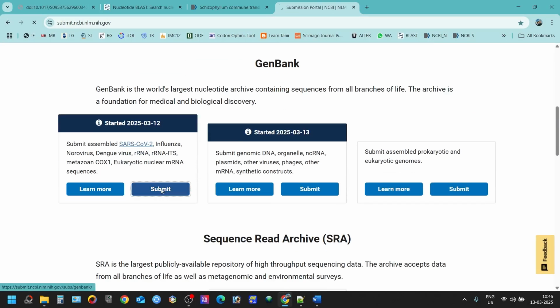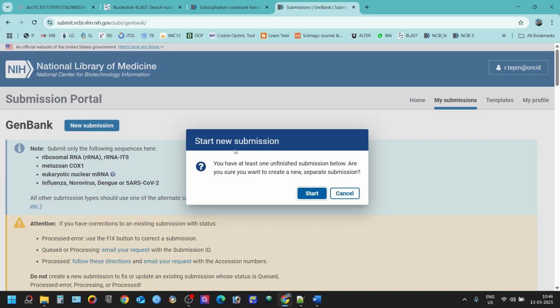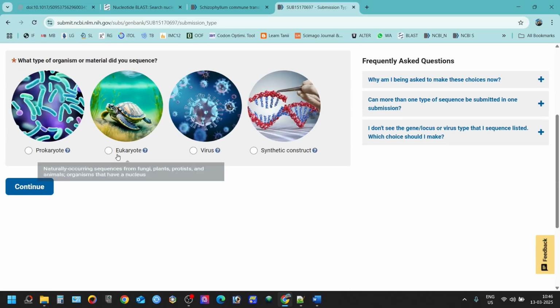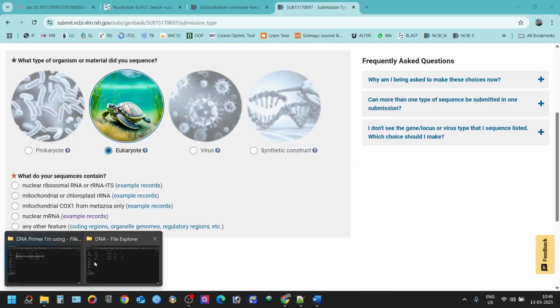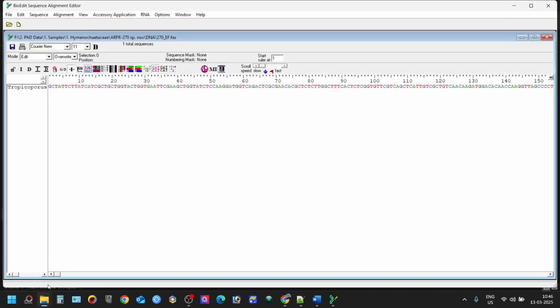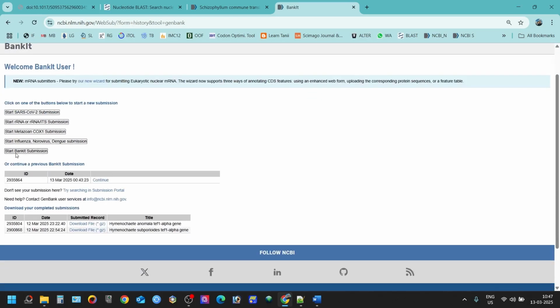You can go to here, submit, and I'm going to walk through all these things that you need to do before submitting. So I'm submitting the eukaryotic DNA, and the protein coding region or the partial protein coding region that I'm submitting is a translation elongation factor gene. This is the sequence. It is 554 sequence long. You have to choose this coding region feature. Click here and start Bankit submission.